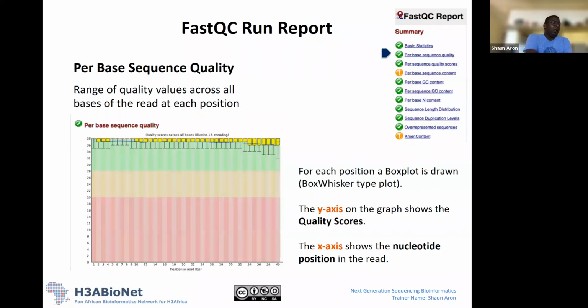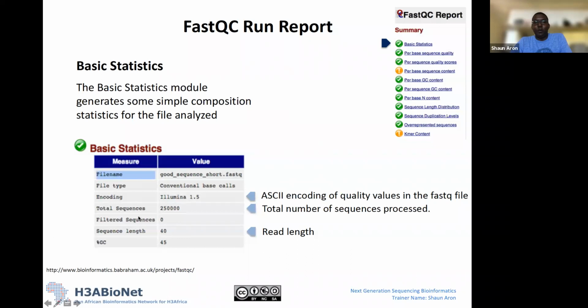Okay. The next part of the report, if you scroll down, is the per base sequence quality. This is the range of quality values across all bases of the read at each position. Remember before I said that in this particular file we have reads that are 40 base pairs long.